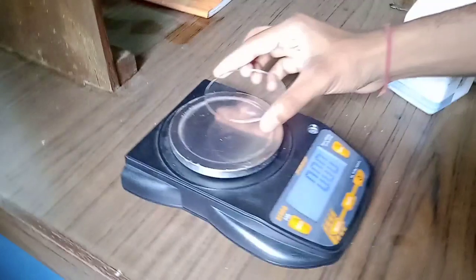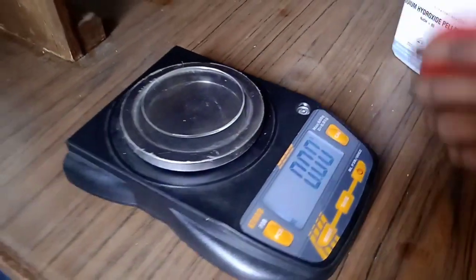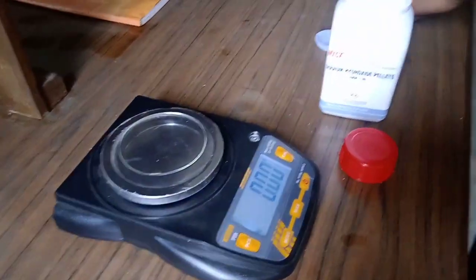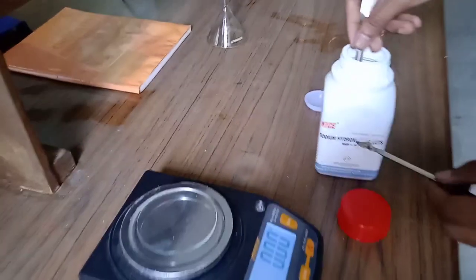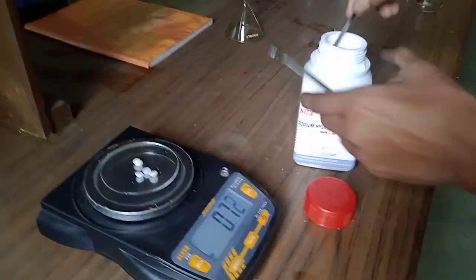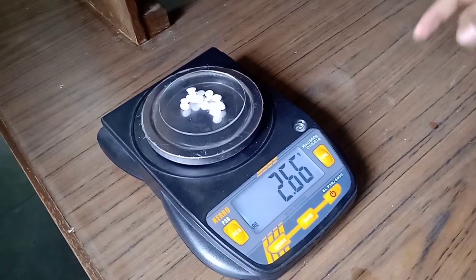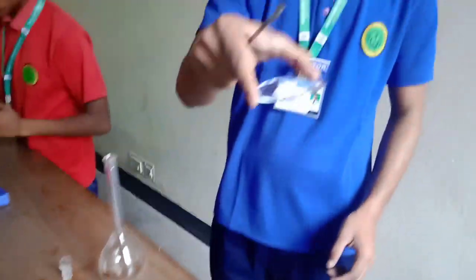We will add the sodium hydroxide pellets and measure them to 2.65 grams. First we will do the same weighing process — as the weight comes we have to tare it. We will open it and with the use of the spatula add pellets. As you can see we have added 1 gram extra — that is acceptable, so we will take this.